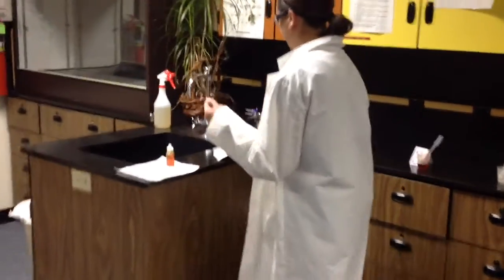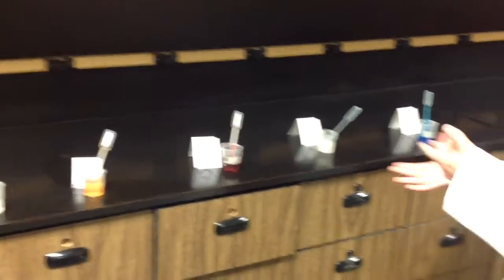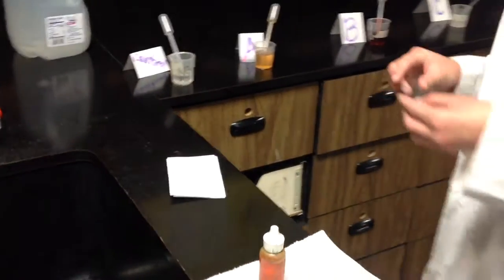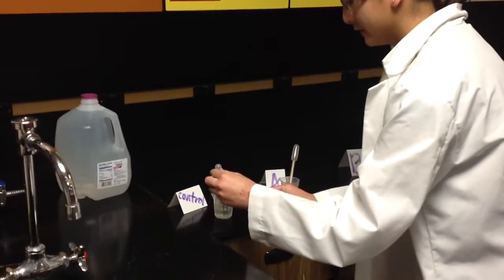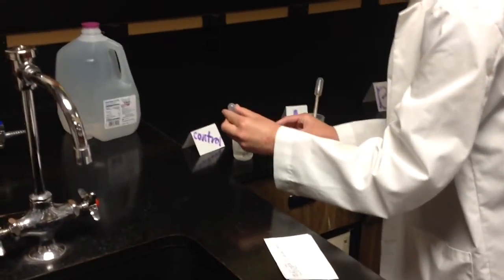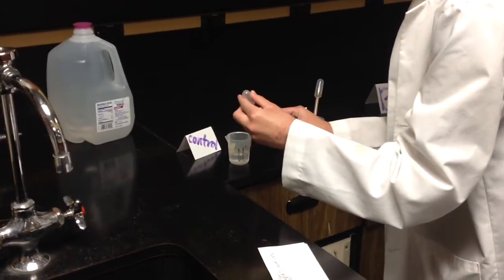We have the control and substances A, B, C, and D that we will be testing. The first thing you should test is the control, which is alcohol itself. We'll take just a little drop on the slide.